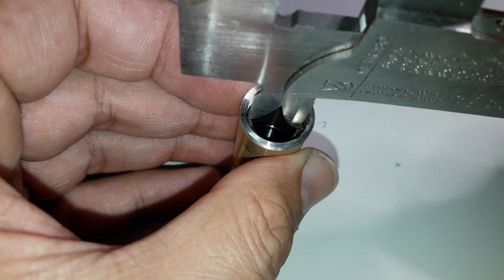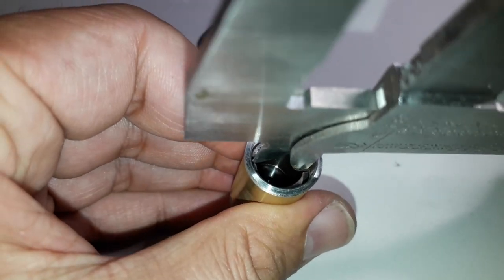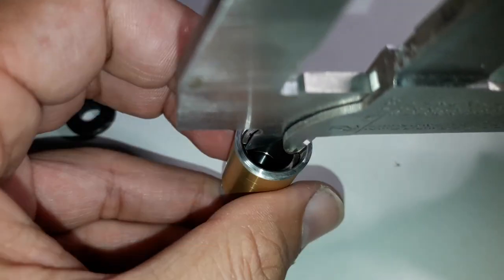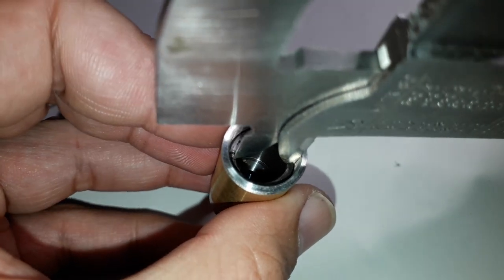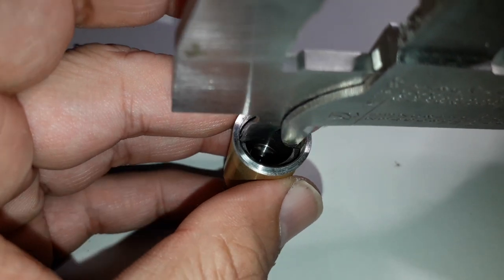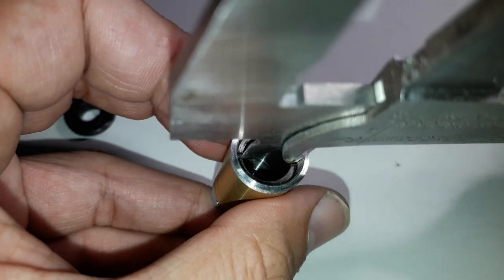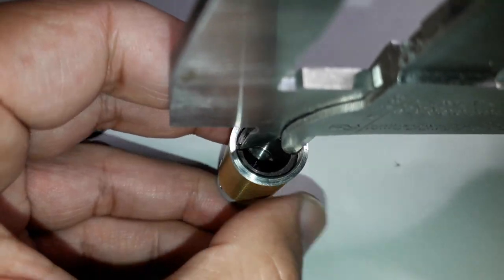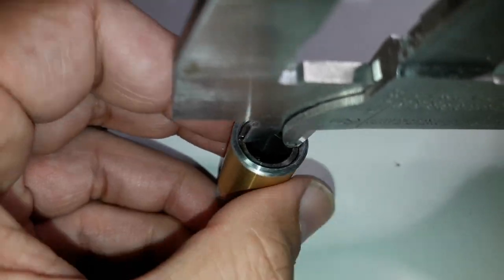Again, a little bit of patience is necessary — everything in real time, no shortcuts. I was quite surprised that I was able to put the whole objective back together again after I finished taking it apart. But this is not something I would recommend that you do with intact objectives, because this will of course introduce dust. And once you've got dust in the system, it's going to be quite difficult to remove that.